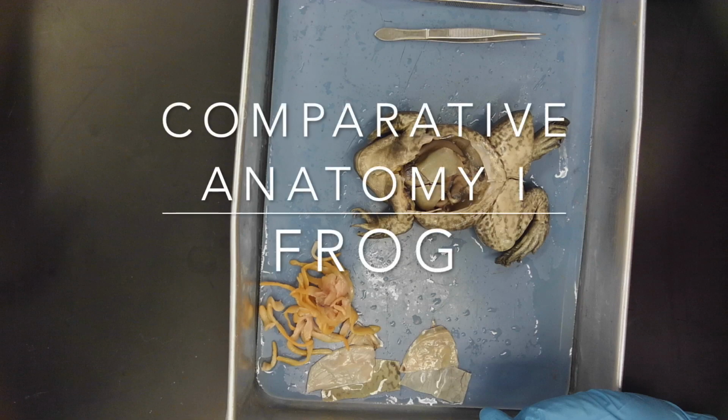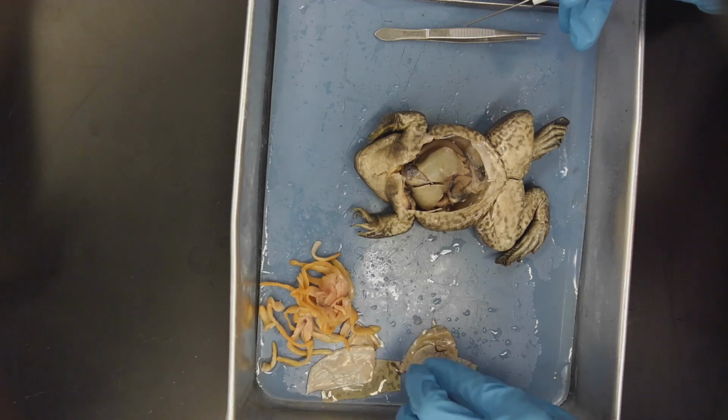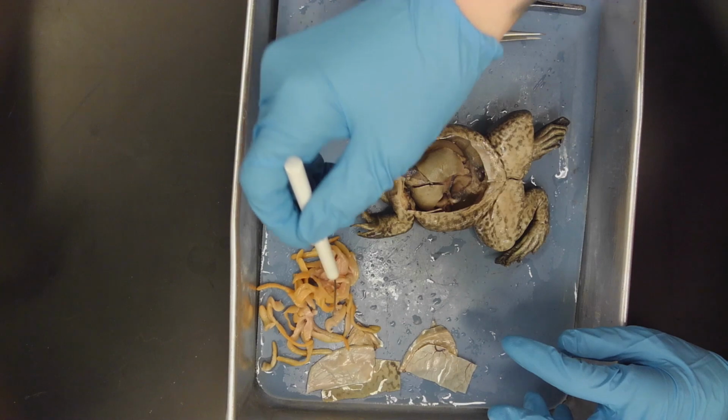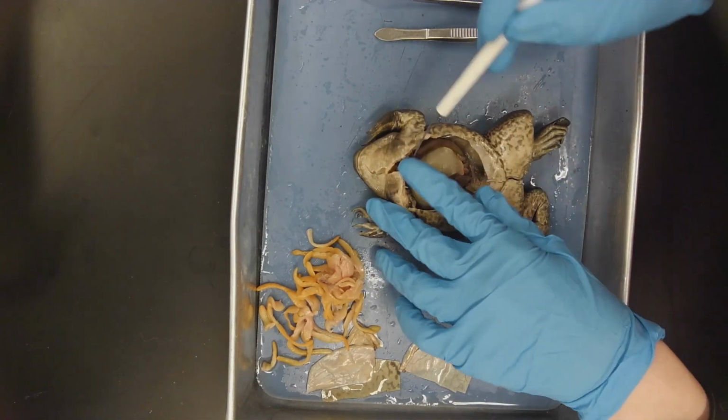Comparative Anatomy 1, the frog. So here we have our frog. I've already dissected away his skin. Here we have the fat bodies, which when you first open the cavity line the interior, but I've removed them so we can view the digestive system.